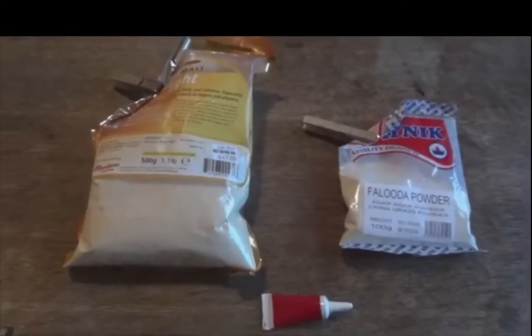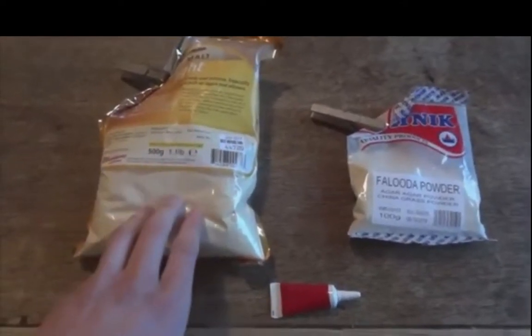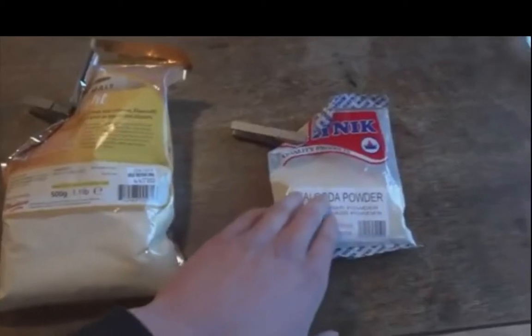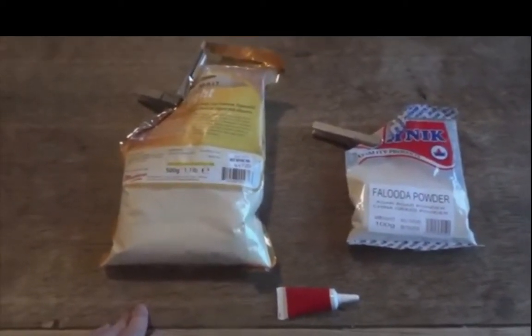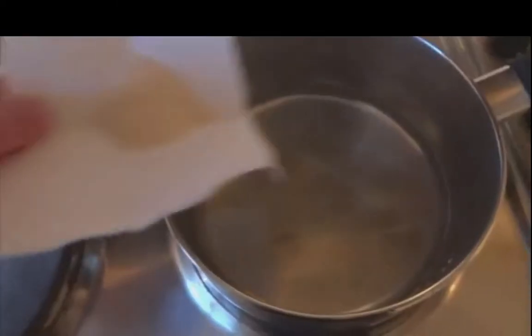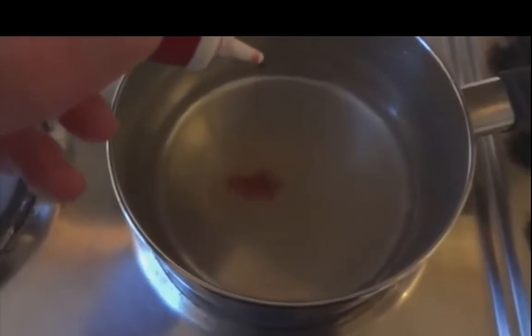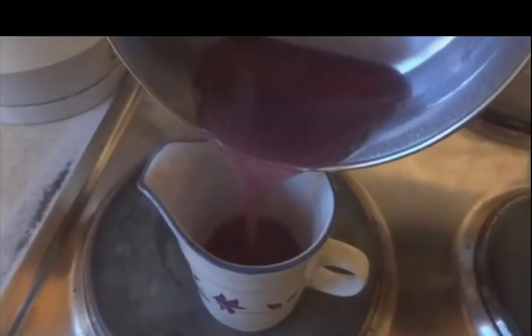Right, to start off with, you need a food source that also provides nutrients. I'm using light malt extract, and you also need the gelling agent, which is agar, and some food colouring helps to see contamination. My recipe is 2 grams of malt extract per 100 milliliters of distilled water, followed by 2 grams of agar, followed by about 10 to 20 drops of red food colouring, blue also works. This is followed by heating and strong stirring to get it all to dissolve.